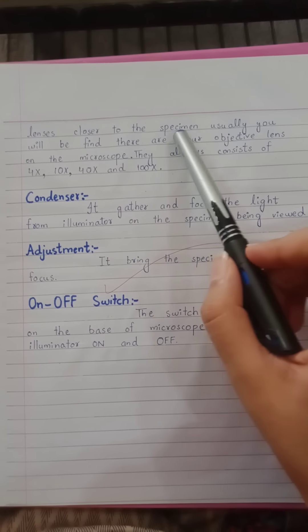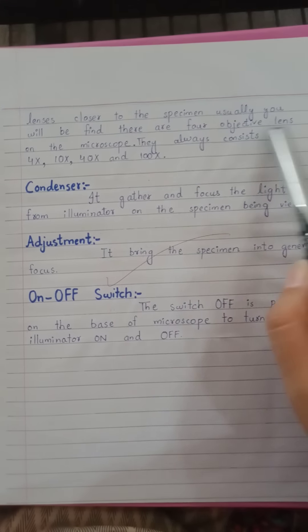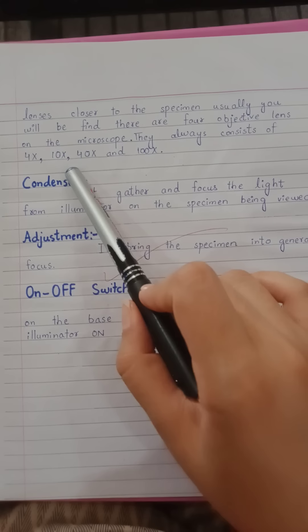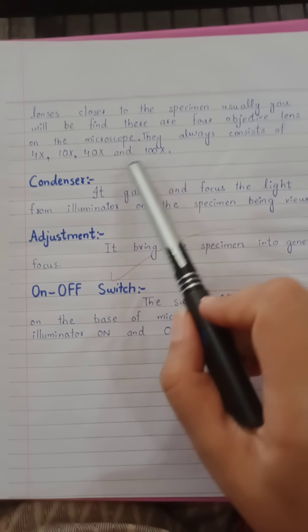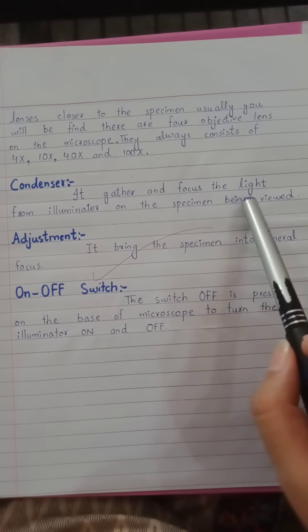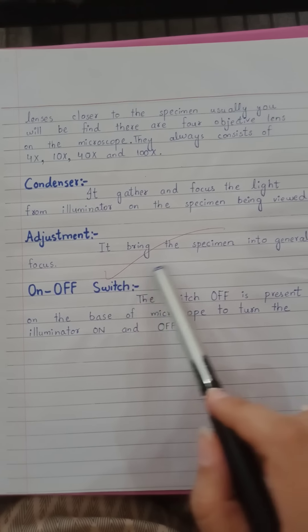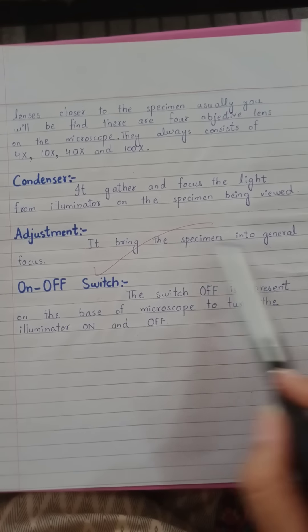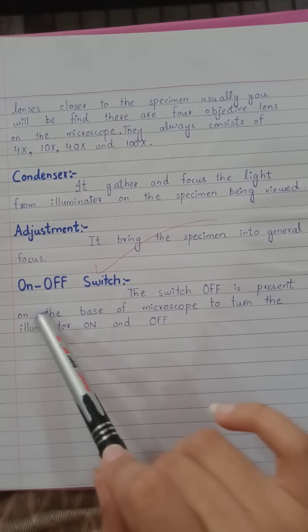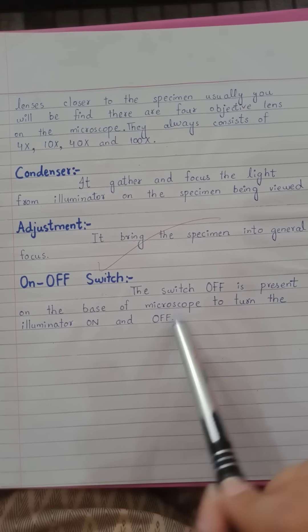Usually you will find four objective lenses on the microscope — they consist of 4x, 10x, 40x, and 100x. The condenser gathers and focuses the light from the illuminator on the specimen being viewed. The coarse adjustment brings the specimen into general focus. The on/off switch is present on the base of the microscope to turn the illuminator on and off.